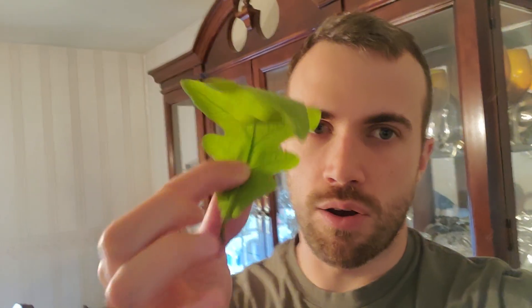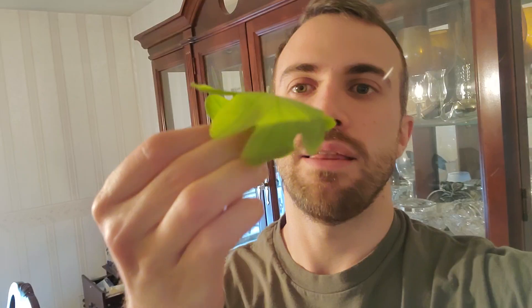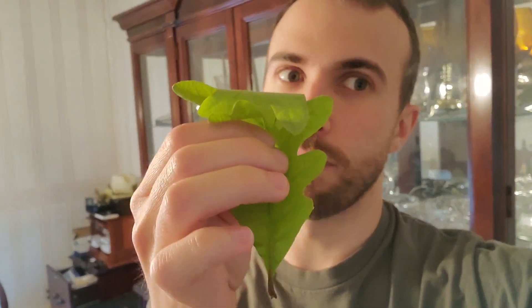So a microscope is this cool tool that kind of works like a telescope. You know how a telescope can see stuff that's really far away? Well a microscope lets you really zoom in on pretty much whatever you want. So we're going to zoom in super super close on this leaf. I went outside, I pulled this leaf off a tree, and this is what I'm going to use with my microscope.